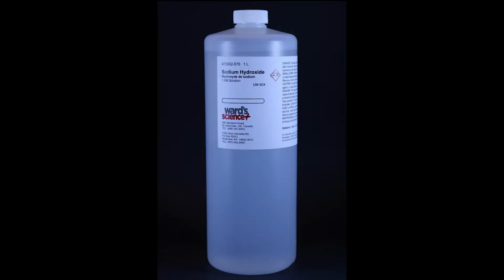The following compounds listed here were used in the double displacement reactions. When viewing the observations and procedures section, the reactants used for each reaction are clearly labeled on individual test tubes. Take note of the correct reactions when writing your lab report.